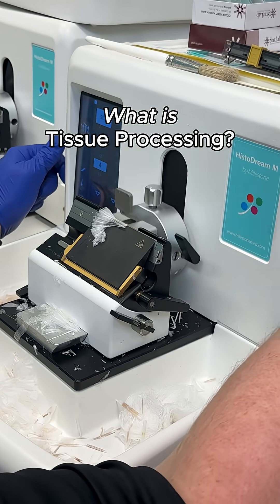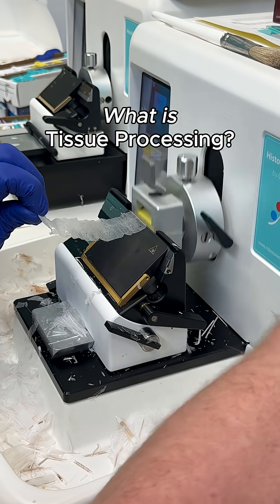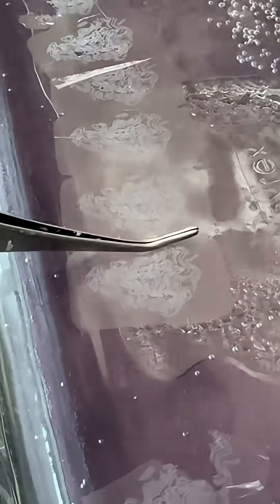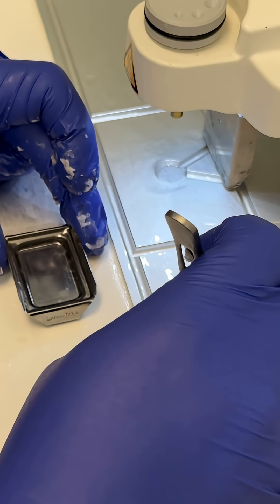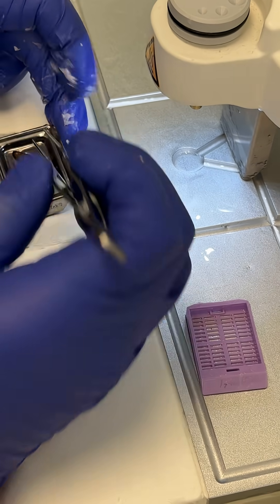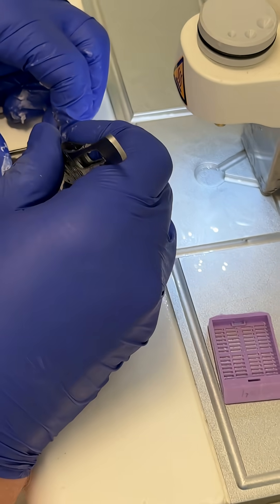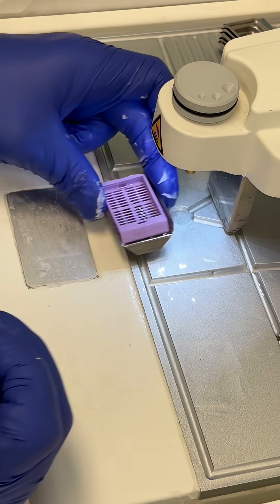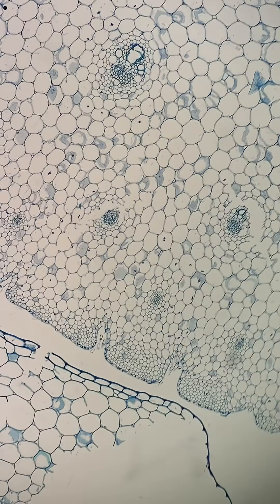What is tissue processing? If you've ever wondered how a biopsy becomes a glass slide for microscopic diagnosis, the answer is histology. One of the most important steps of the histological process in the lab is tissue processing — the critical step that turns fresh tissue samples into something pathologists can actually examine under the microscope.